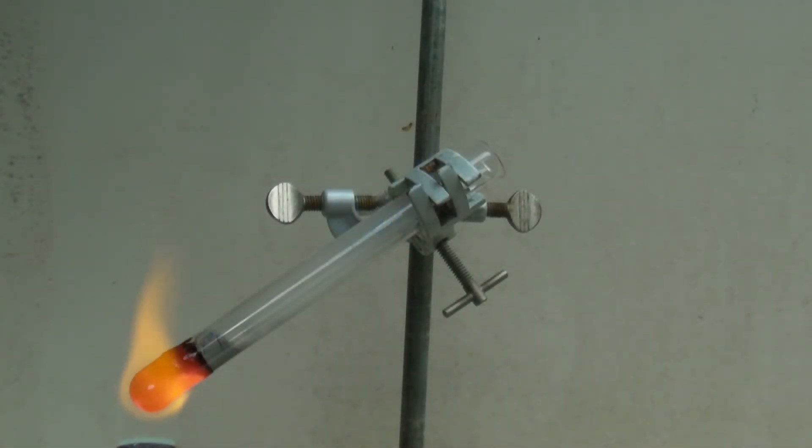It can often be read that the layer of sand on top of the mixture is not required. But it prevents the magnesium from reacting with humidity and the formed hydrogen to ignite. Usually this does only cause a little jump scare but should still be prevented due to safety reasons.